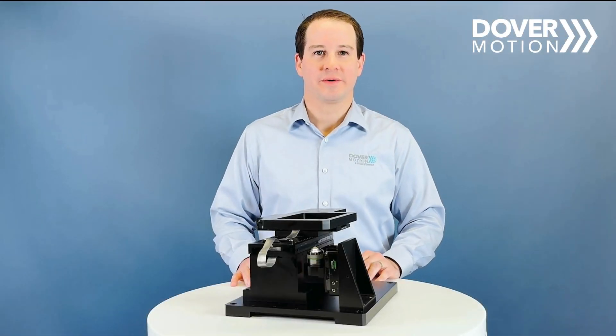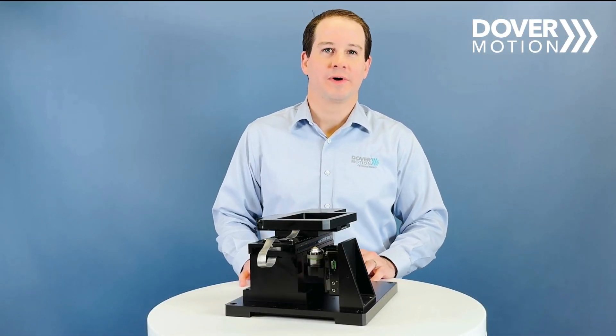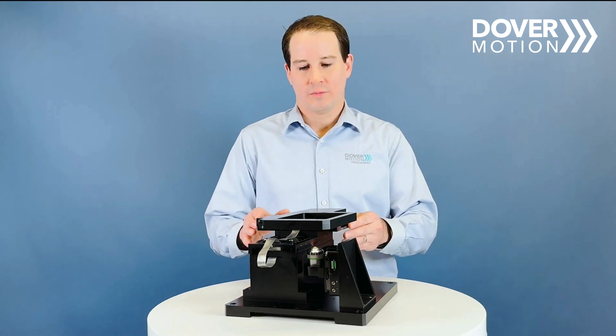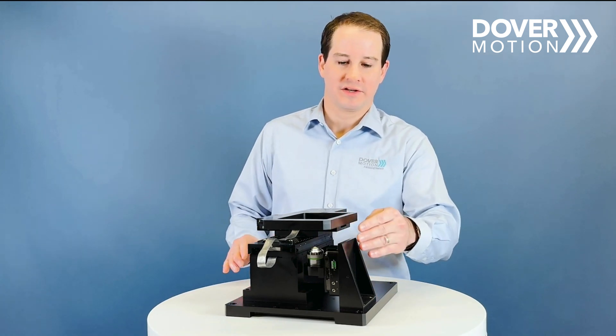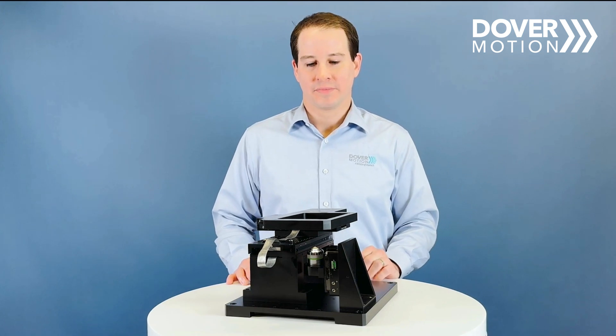Hi, I'm John Garrity with Dover Motion. Today we'll be talking about XYZ stages. What we're showcasing here today is a Smart Stage XY and a DOF5Z focusing stage.